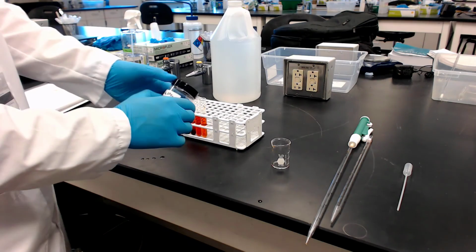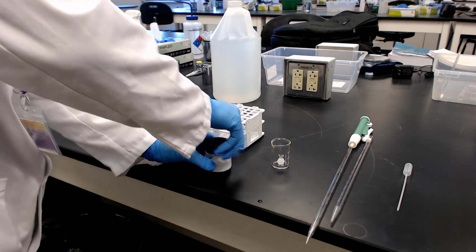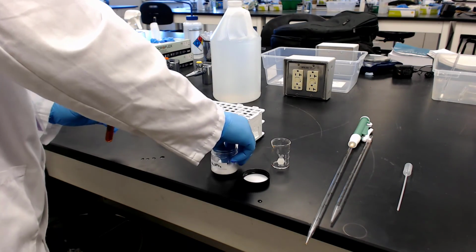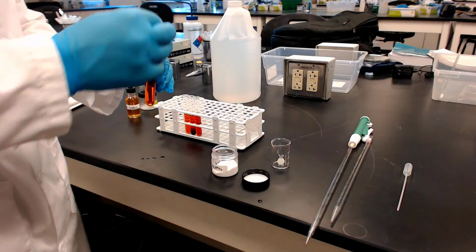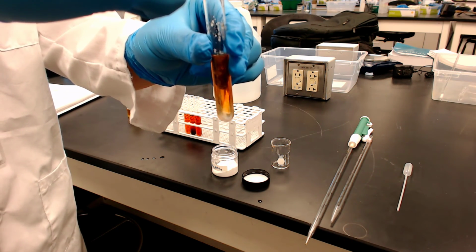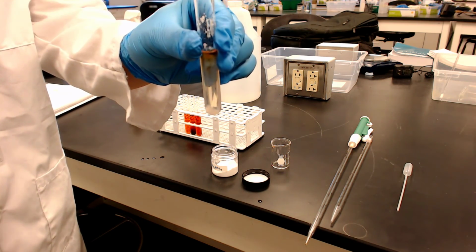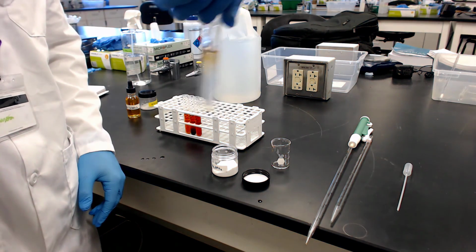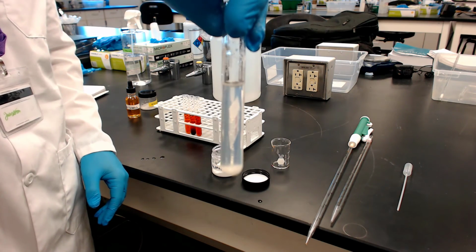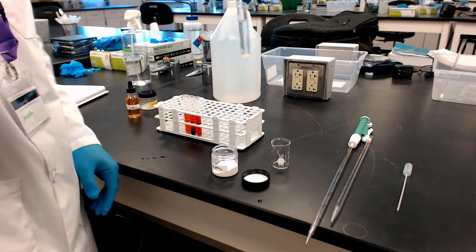So here he is. He's looking that over for some reason, but yeah, we're going to hopefully add that to test tube 4. There you go. Add a few crystals. Again, this technique is not what we do. The best way to do that is to have your own spatula, right? We don't want to contaminate that vial. Boy, look at that shift in equilibrium. That's awesome. So just a little bit more, there we go. That's going to be a great picture. There's a product, or the new established equilibrium.